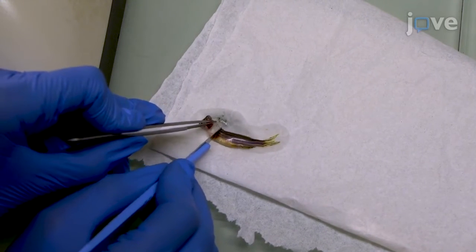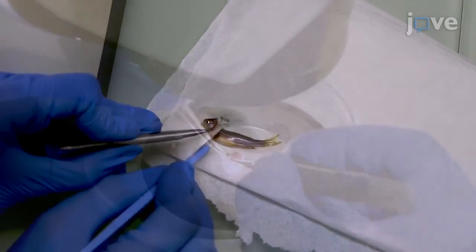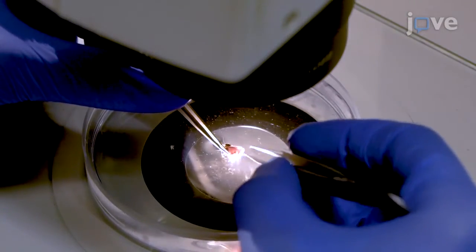Use forceps to gently break open the skull and remove soft tissues, skin and bones from the ventral and dorsal sides of the skull.